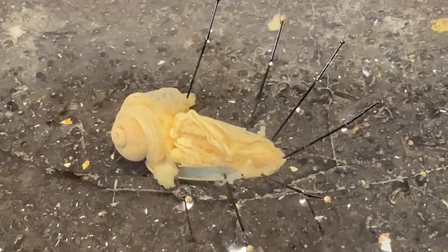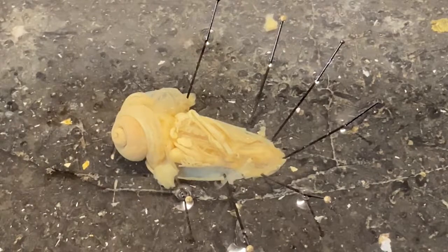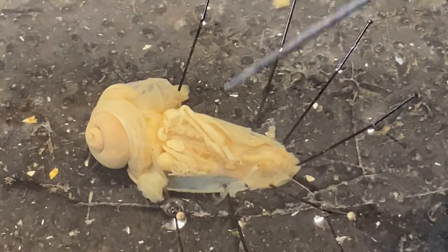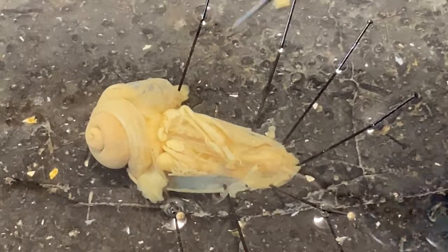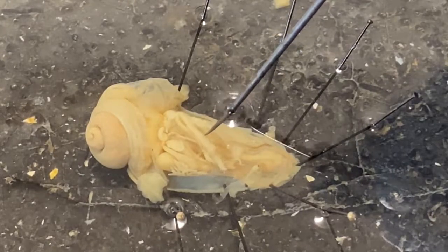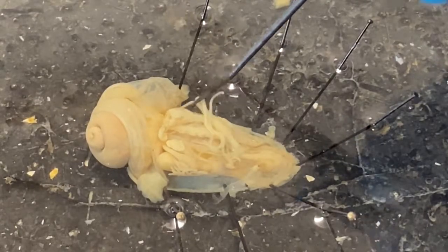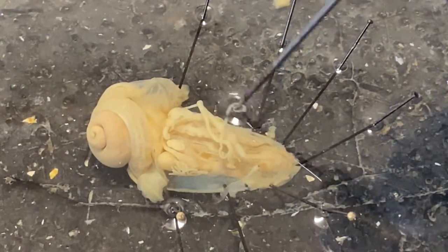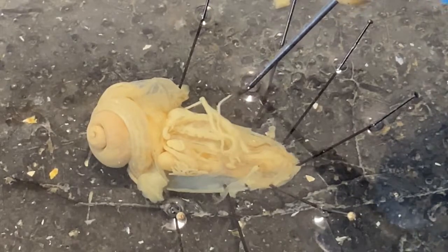I've opened up the dorsal body wall of the snail, and there is a lot of stuff in there. Let's look at a few things we can identify pretty easily. This structure right here that curls around like this is the penis, and it's attached posteriorly — there's a muscle attaching it back here so that the penis can be retracted after fertilization. This thread-like structure coming off of the penis is called the flagellum.